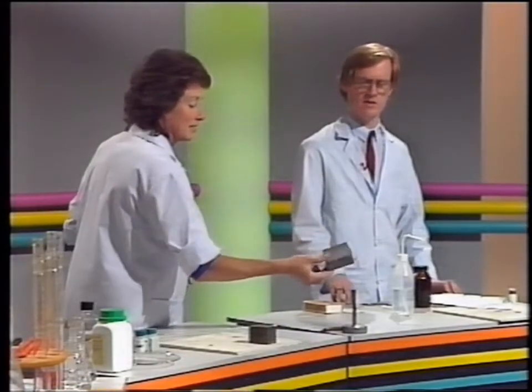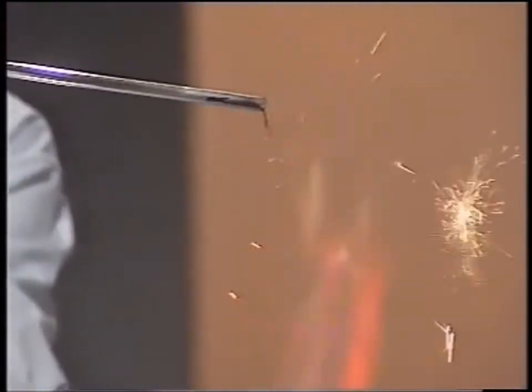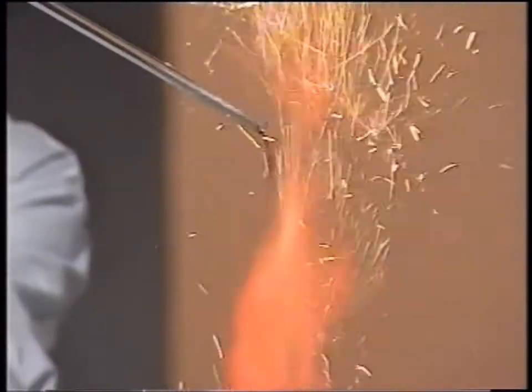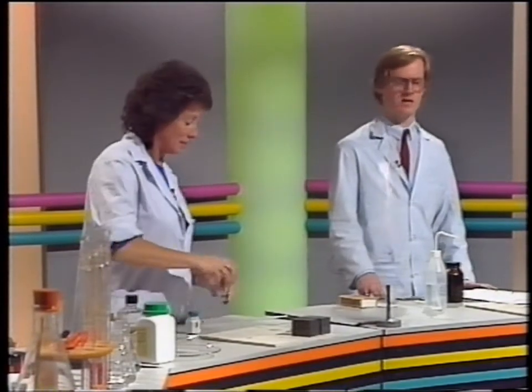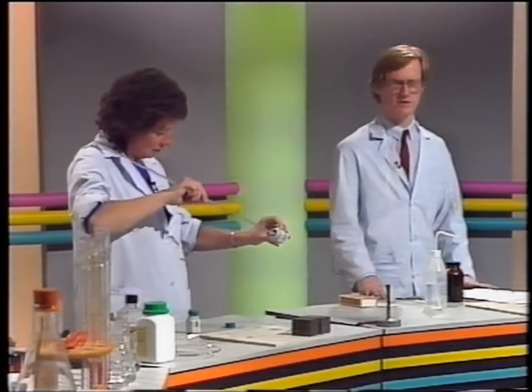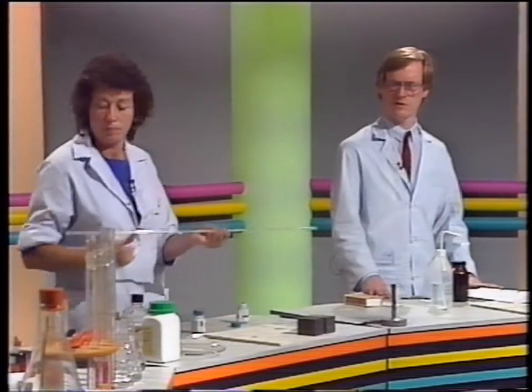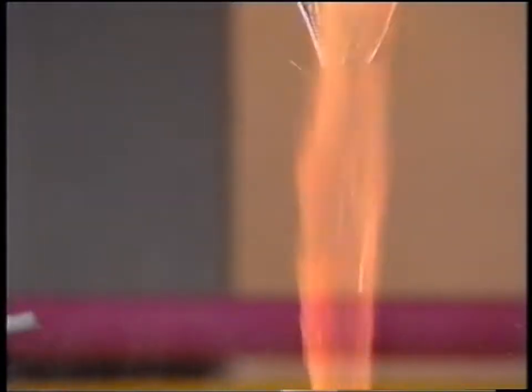A solid lump of iron or aluminium will not react with the oxygen in the air because the particles can't mix. If we make the particles mix more efficiently with those in the air, we do get an obvious reaction, and this is the sparkler effect that you get with iron powder. If we do the same kind of thing with aluminium, which didn't react at all in the first instance, now it's a very fine dust, its particles can mix very, very efficiently with the particles in the air, and we get an instantaneous and rapid bright reaction.